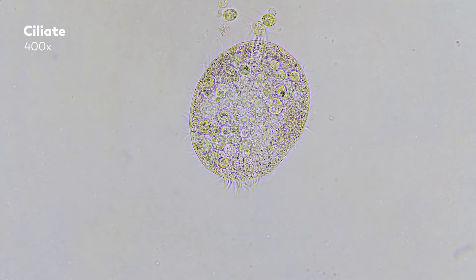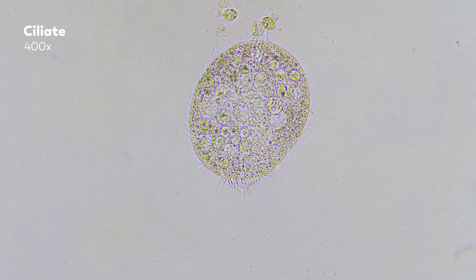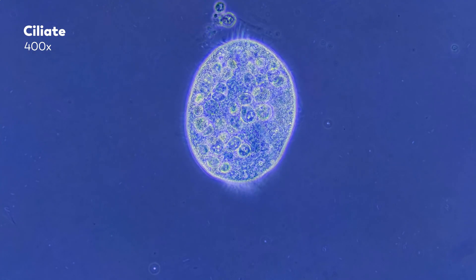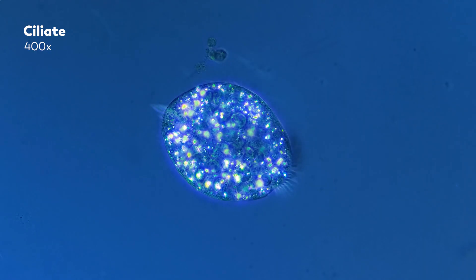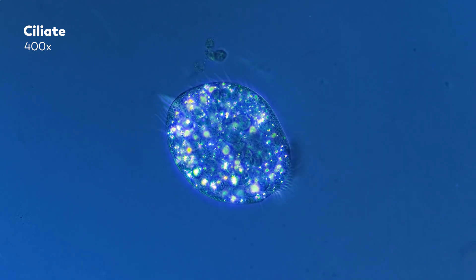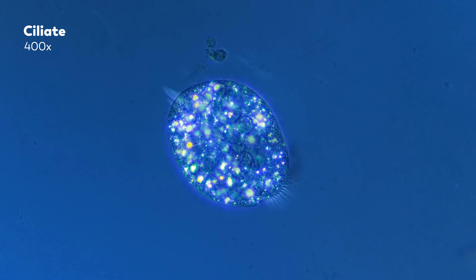This is a ciliate, just a eukaryotic microbe waving its cilia around under our microscope. And this is the same ciliate — shown again and again. But as you're probably noticing, while the rough outline of this organism seems the same from shot to shot, the ciliate itself and the world around it clearly look very different.